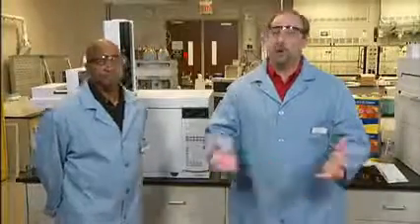Again, injecting a standard or component of known retention is the best way to verify you have the correct flow, if all the other settings are correct. Okay, that about covers it for retention time shifts. To recap, 1. For new column installations, check the exact dimensions of the new column versus the old column, and be sure to enter the right dimensions into your instrument control software. Do a leak test, then check for blockages.